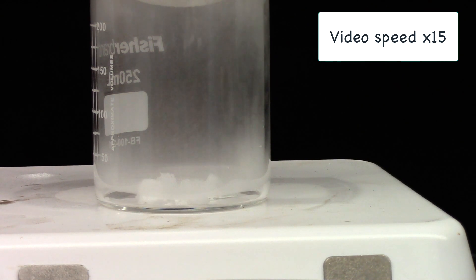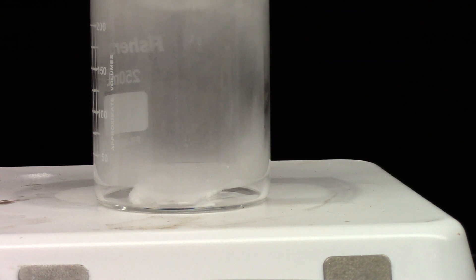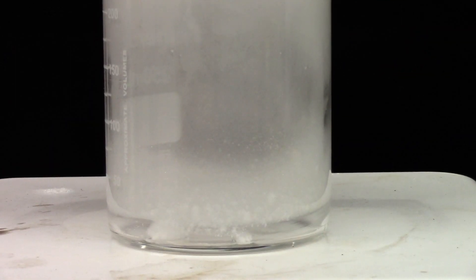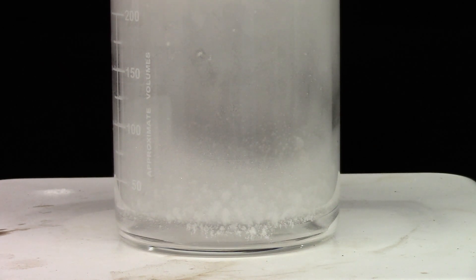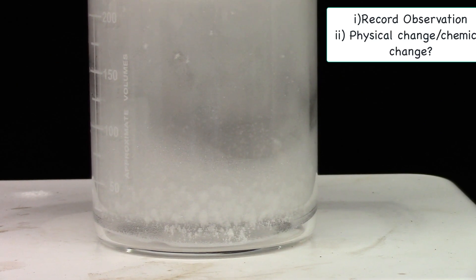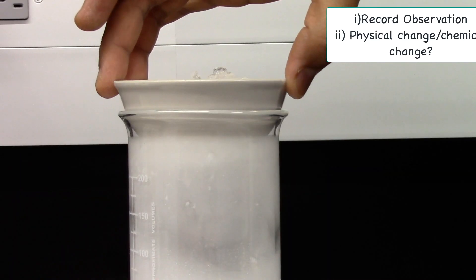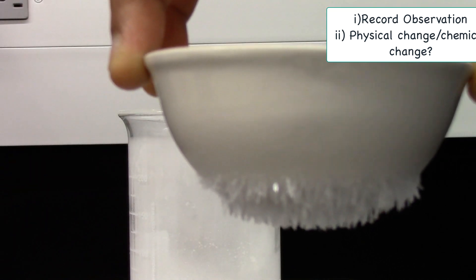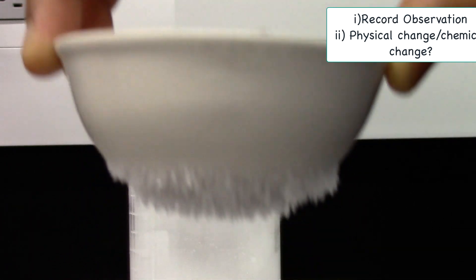All the camphor has collected on top of the evaporating dish. Pretty much all the camphor has evaporated from the beaker. All the camphor is sticking to the bottom of the cold evaporating dish.